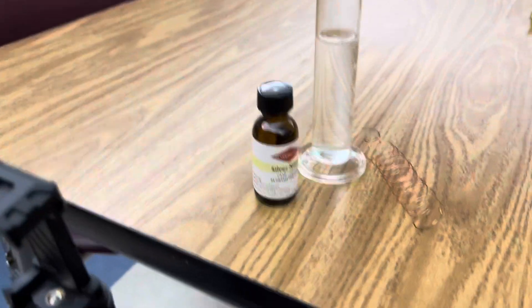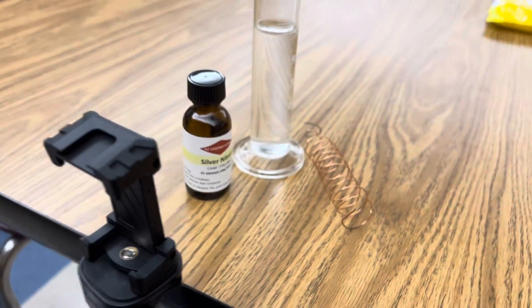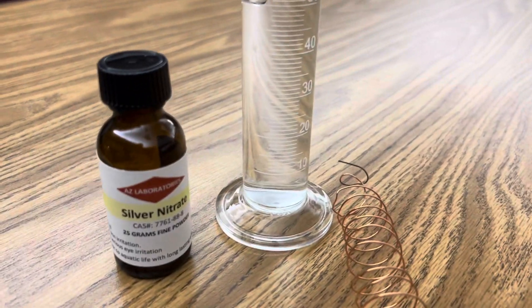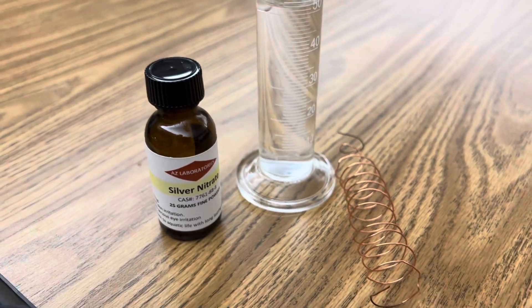You also might want to have a tripod because you're going to be videotaping this for probably over an hour to see crystals grow on the copper wire.